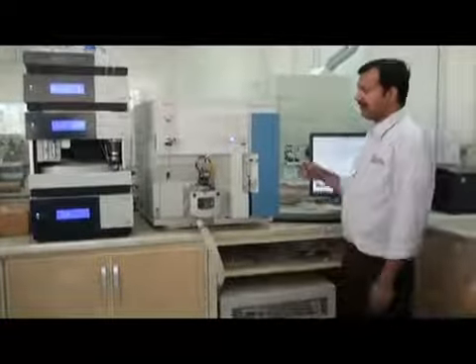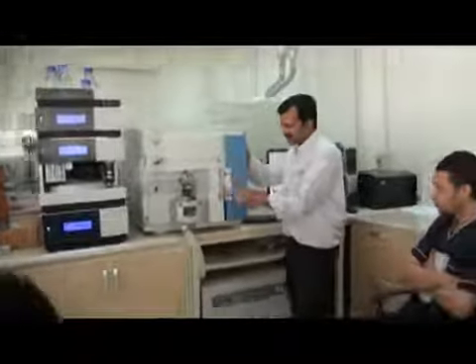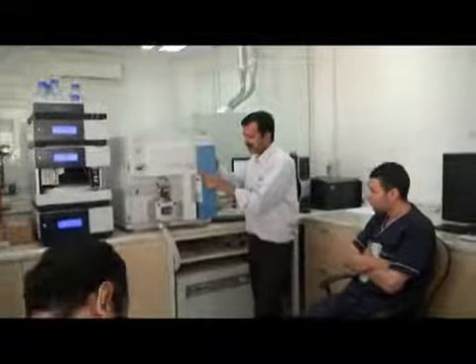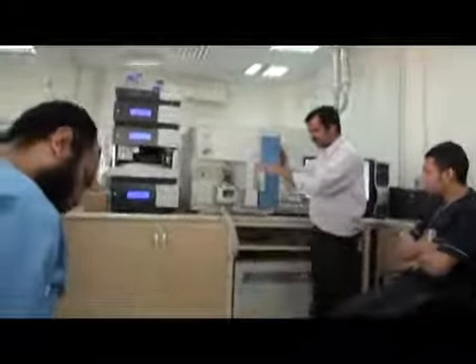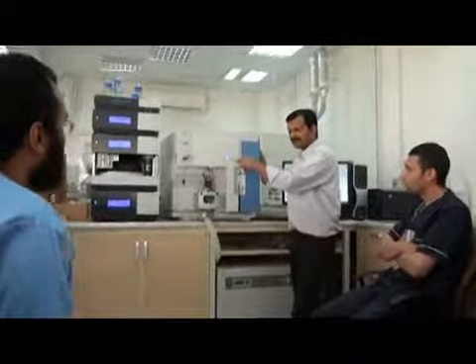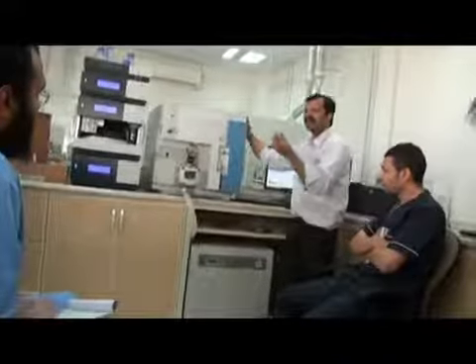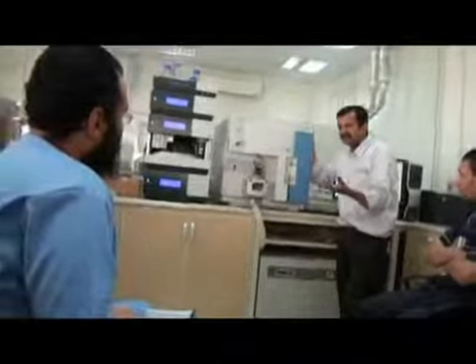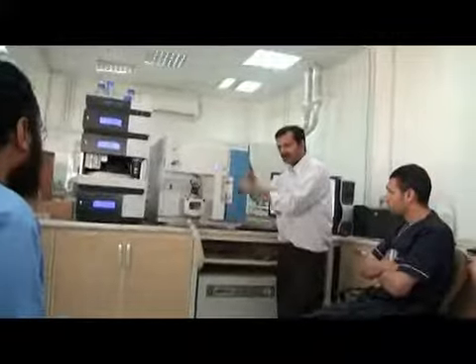Okay. And this is a syringe pump. This button is for the syringe pump. If we press it, the syringe pump is on. It will move a little. This will go down. See. Now it will go fast. So the rate is set here. The rate is very small, like 5 microliters per minute. So a small volume is coming out.